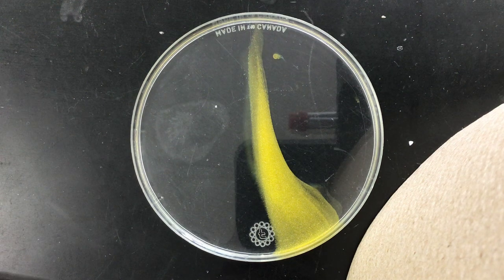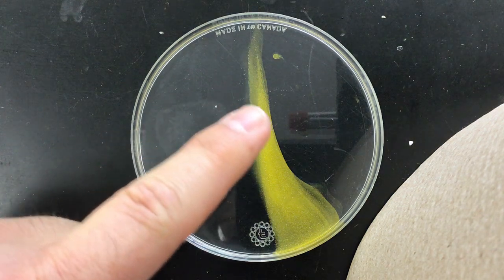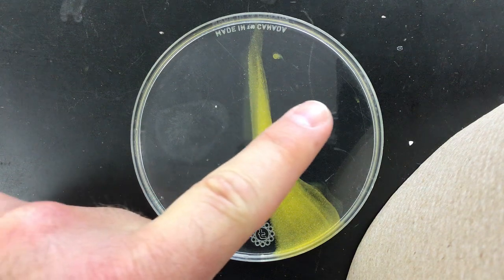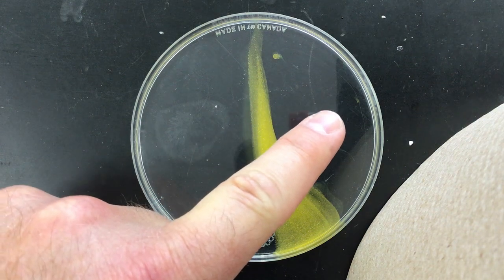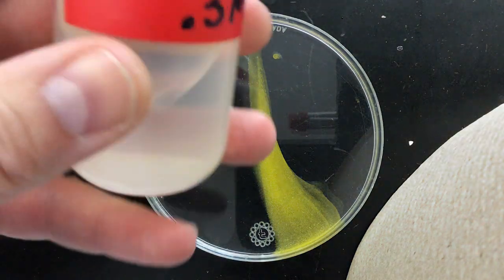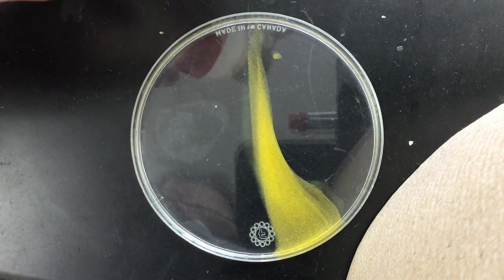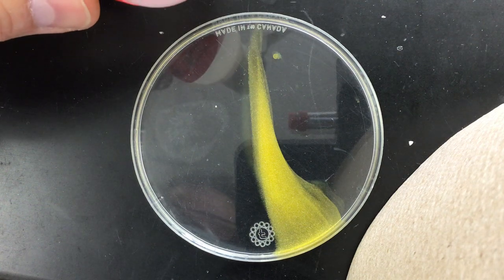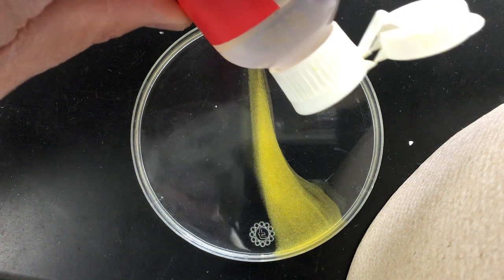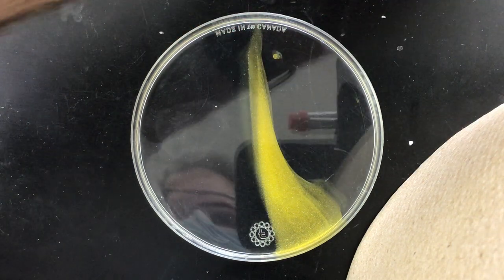What we'll do on the right hand side is add some potassium iodide. So if some of our lead from the left made its way over there without reacting, then adding some potassium iodide — KI — to the right, and if we see a reaction, we know some of the lead from the left made it over. Add a couple drops there.